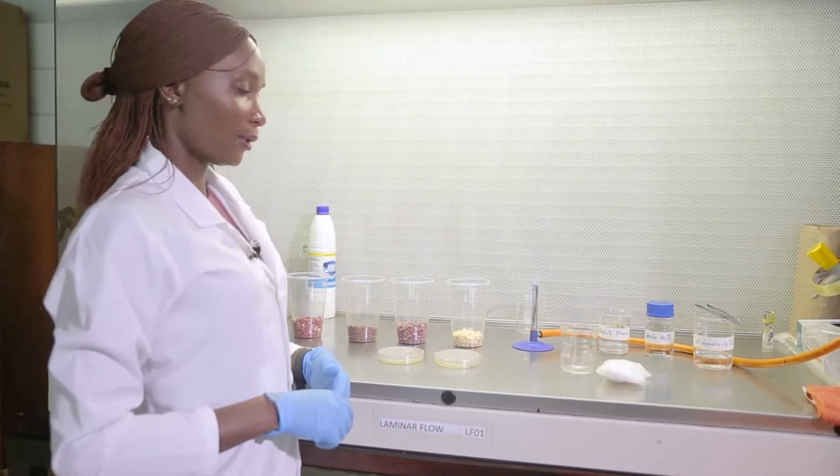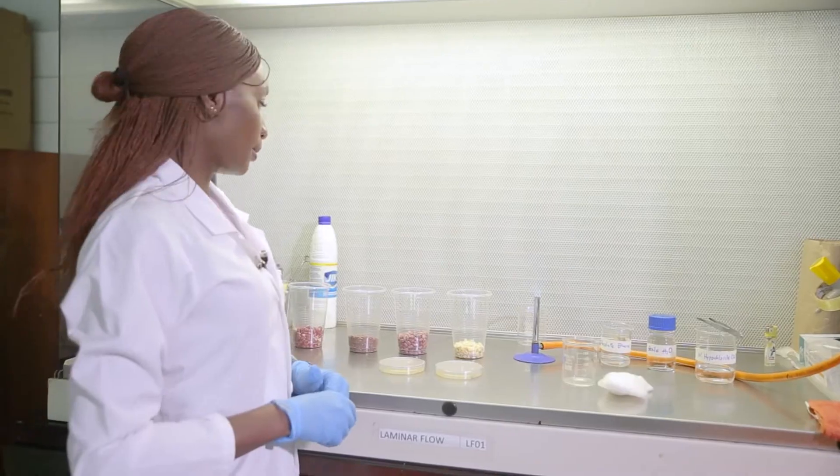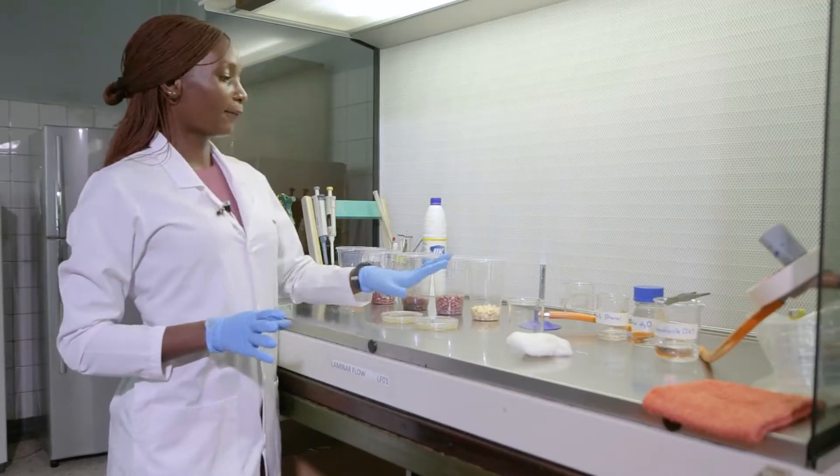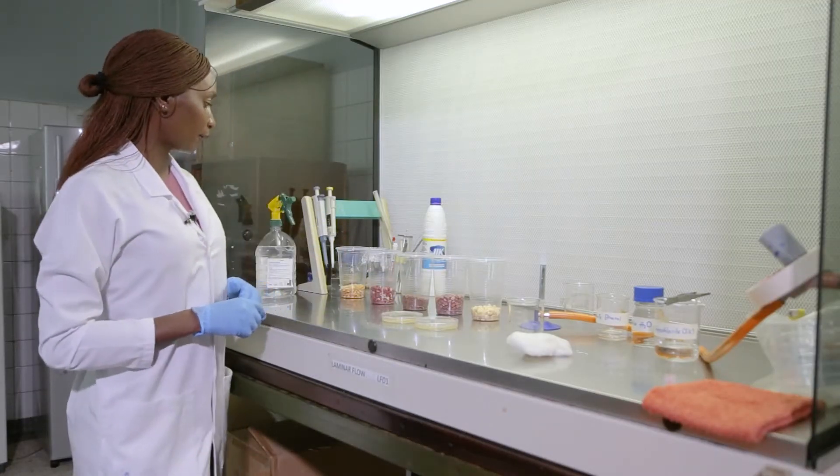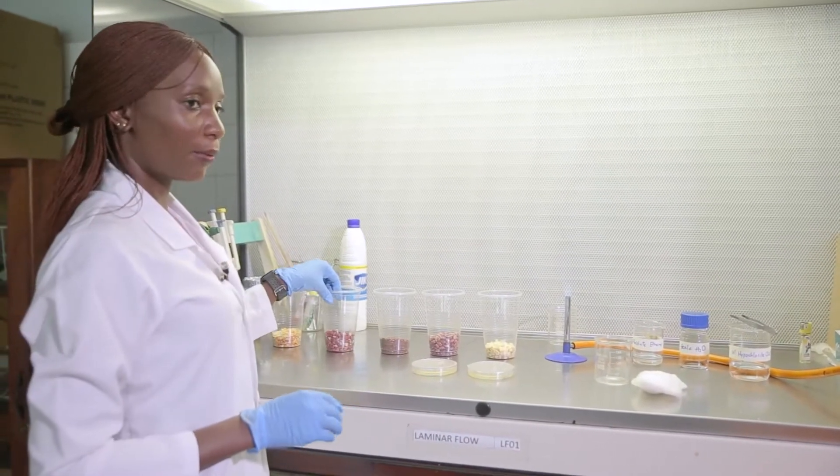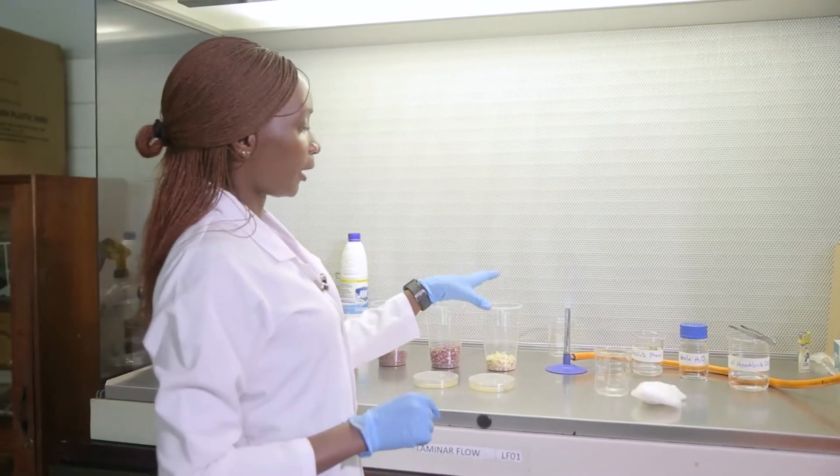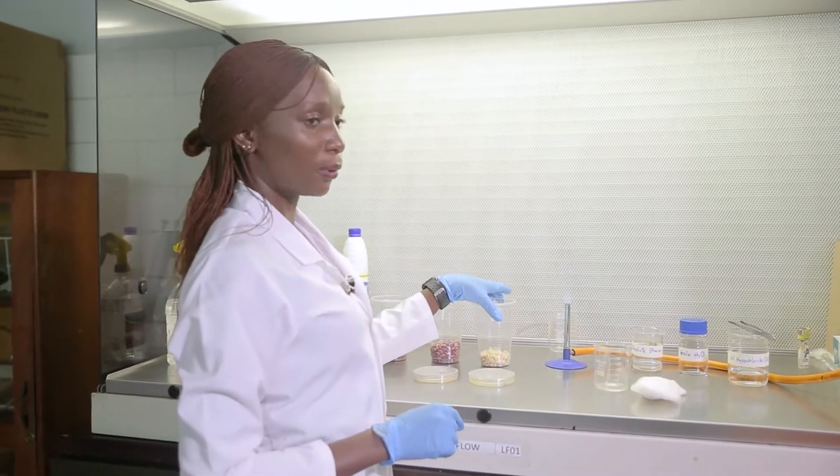Fungi, that is yeasts and molds, contribute to post-harvest losses in grains and seeds. Here we have a variety of seeds and grains. I have corn, or what we usually call popcorn. We have groundnuts, or what some people call peanuts. I have millet seeds. I have beans, and I also have maize, what some people also call corn.